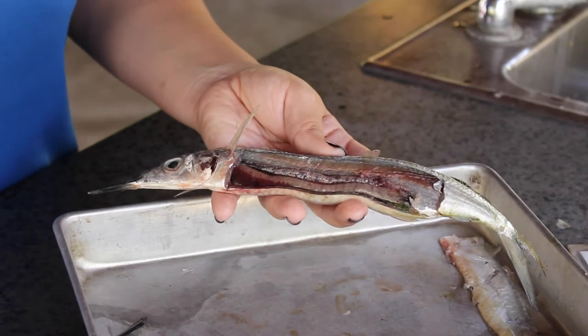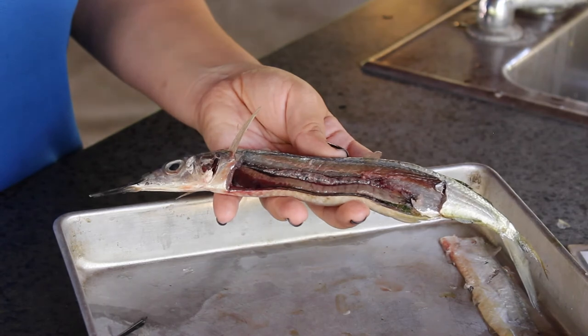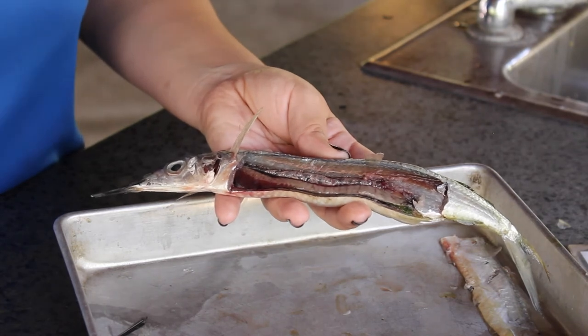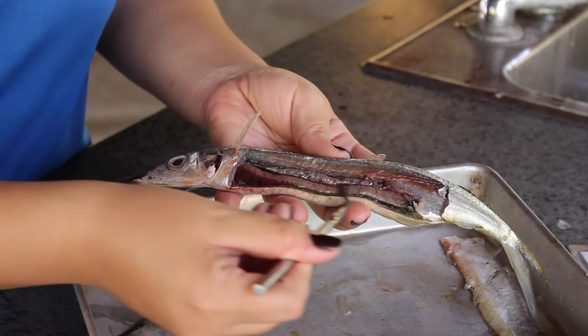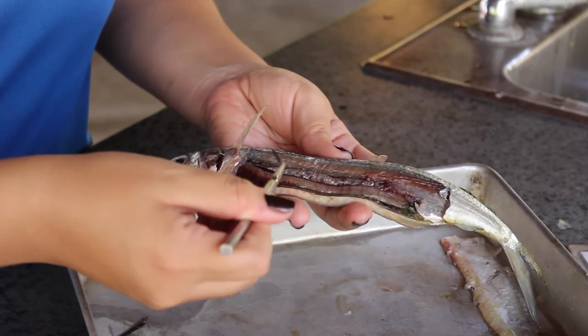Now that we can see the internal anatomy of the fish, we can observe the liver, the stomach attached to the intestines, and the swim bladder.